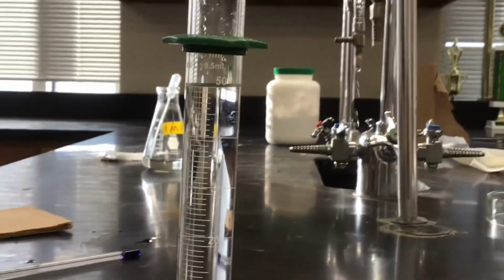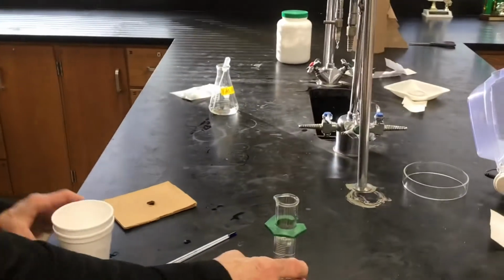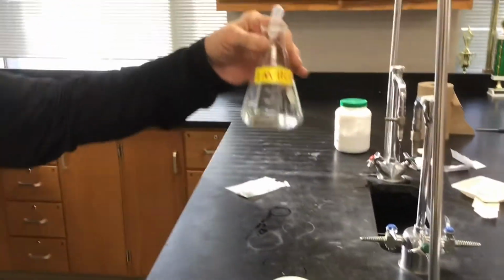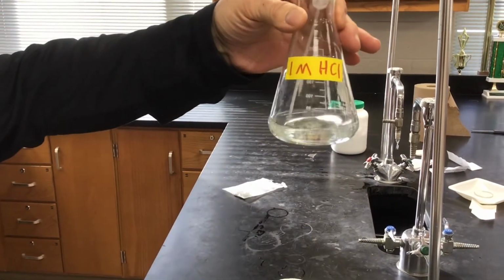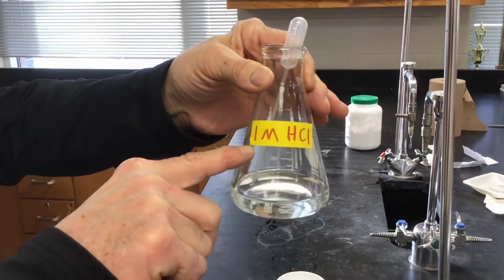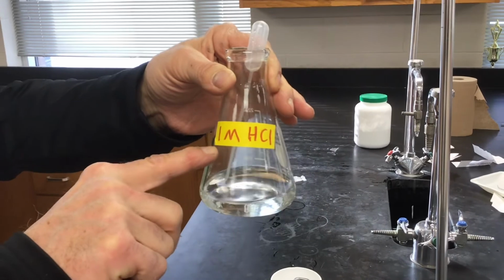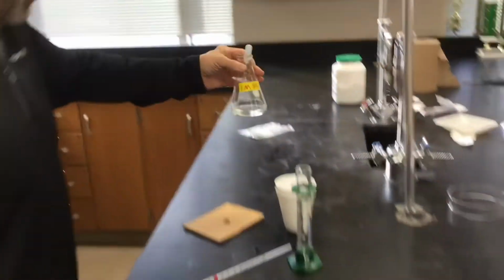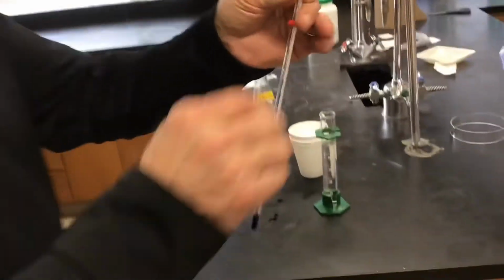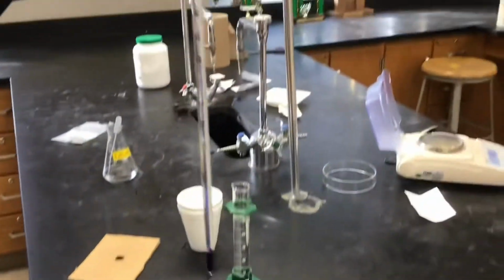There it is. And what about the concentration of the acid? Oh yes, Mr. Moore, almost forgot. So this is the acid we're using. Now, I wrote just 1 molar here, but it's really, think of it as 1.00 molarity HCl that we're using. Yep. And we'll need a thermometer to measure our temperature. And so, here's the thermometer we're using.